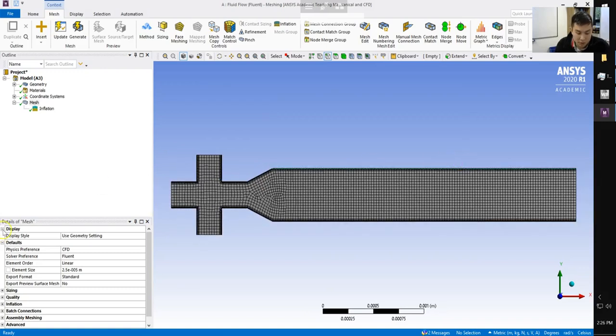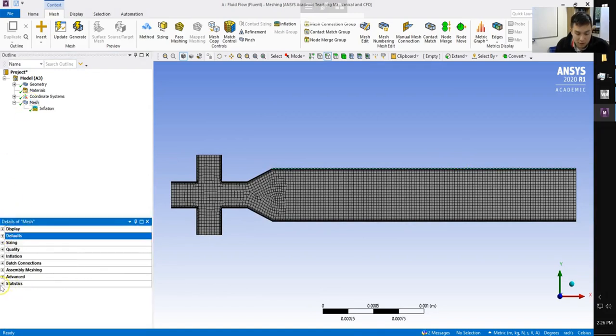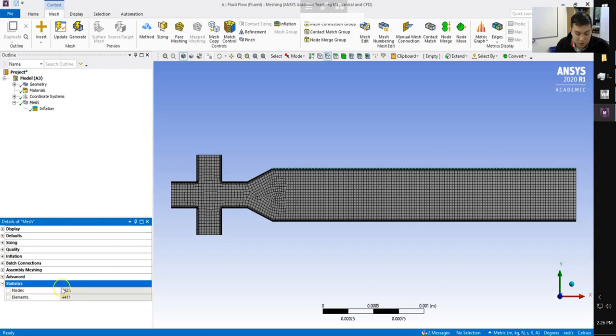So just for reference, in the details, again, select Mesh, Details of Mesh. You can scroll down and see Statistics, and this will give you some information. So the total number of nodes we have is 4,623. And the number of elements we have is 4,400 or so. So you want to make sure you have roughly these values when you perform your meshing.